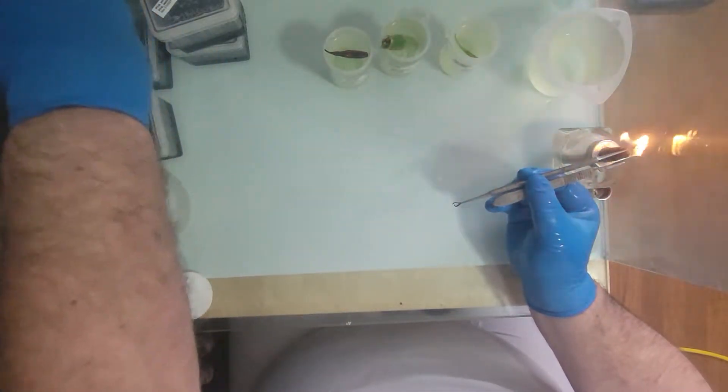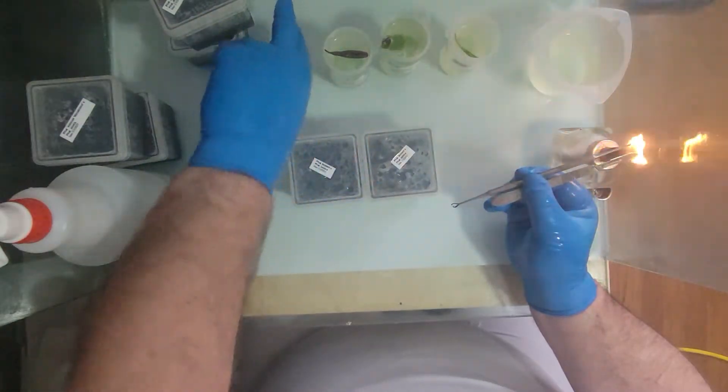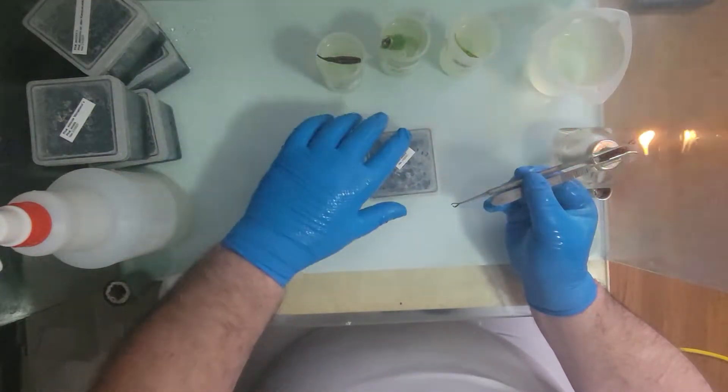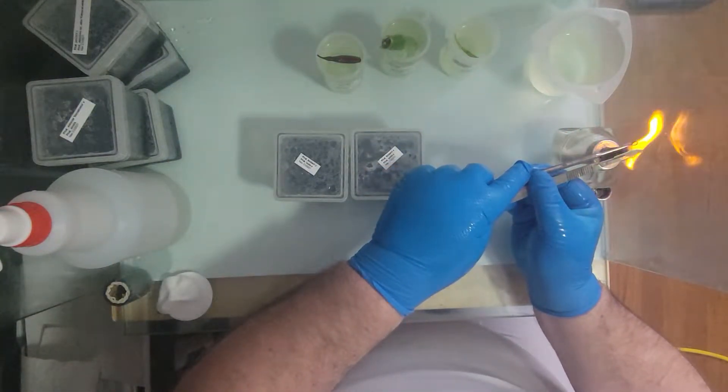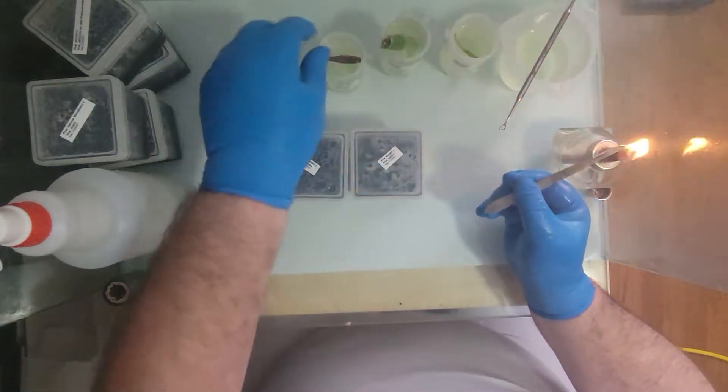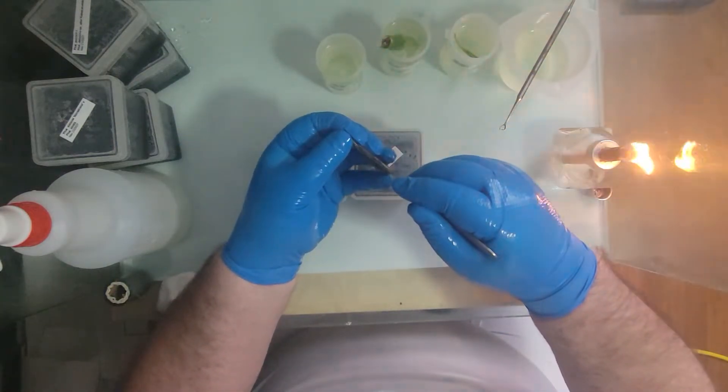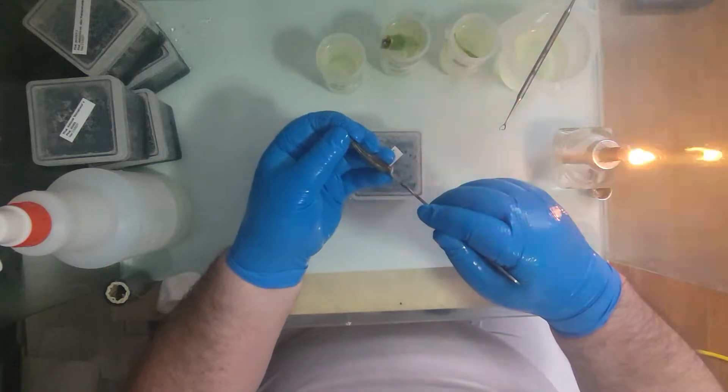While I do that, I will get the first seed pod ready. Great. Fairly straightforward. You take the seed pod, you take the incision down the length of it.